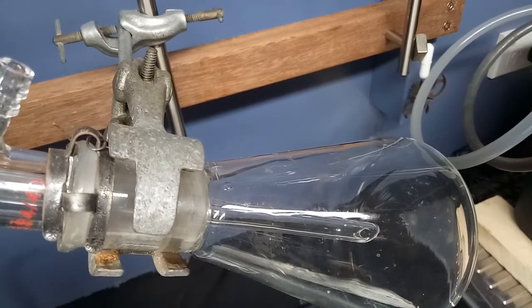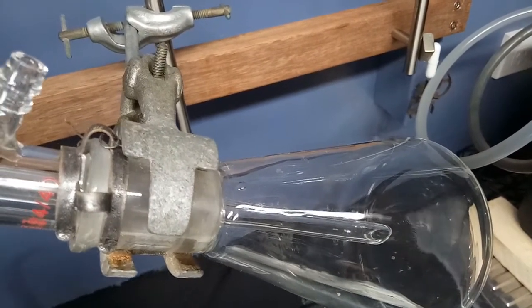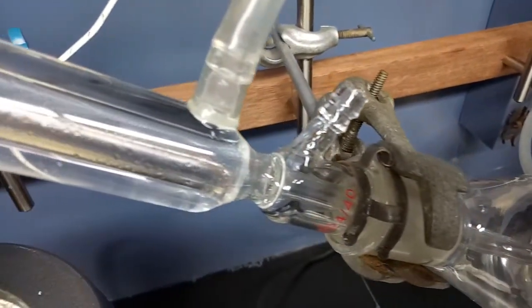And, in this case, I'm using a short path condenser. I quite like using this. It's quick and efficient to set up, and to clean and pull down.